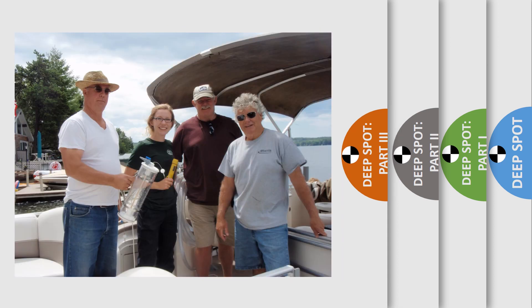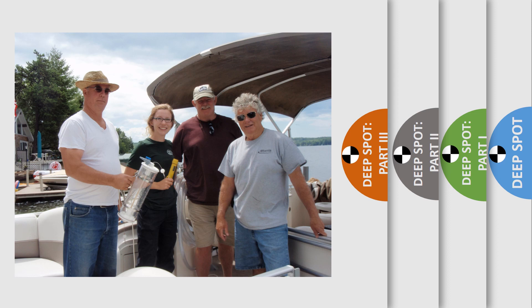That's it at the deep spot. Pack up your equipment and pull up your anchor. You're now ready to conduct your tributary sampling.